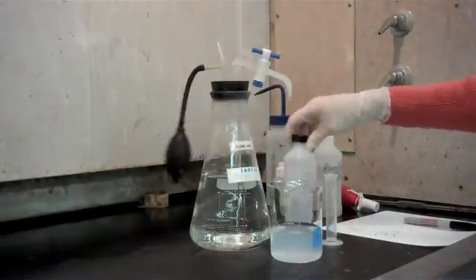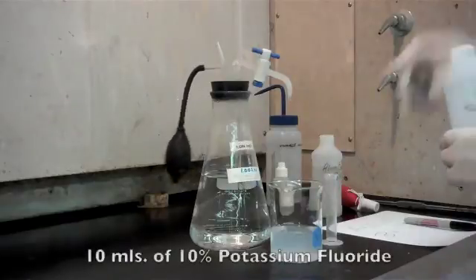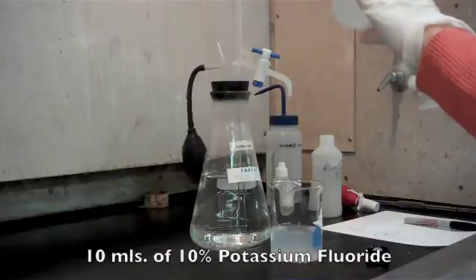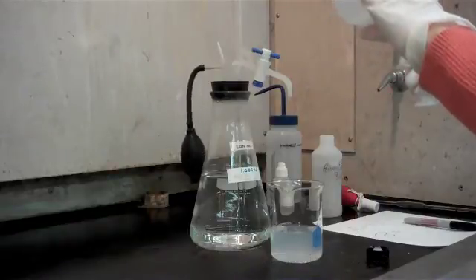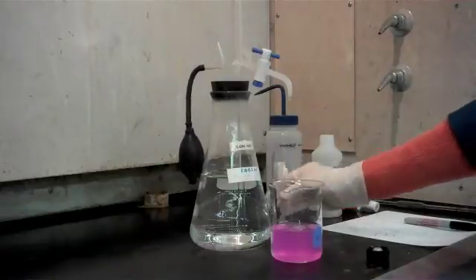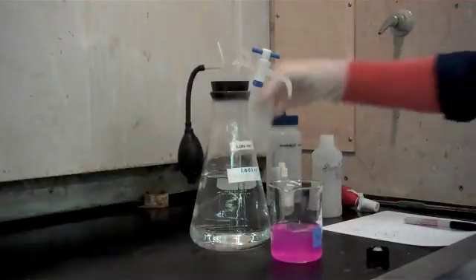Then I'm going to add 10 mils of a 10% potassium fluoride solution. And as you can see, the solution turns pink again.